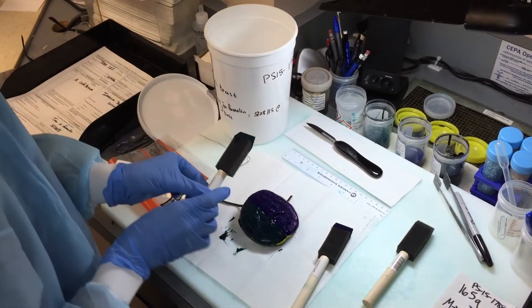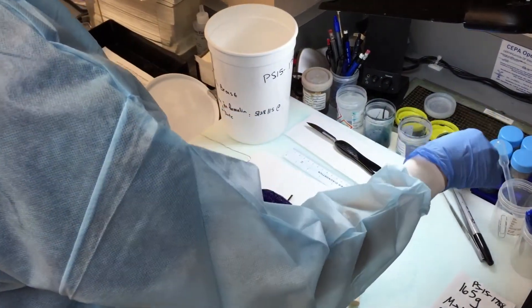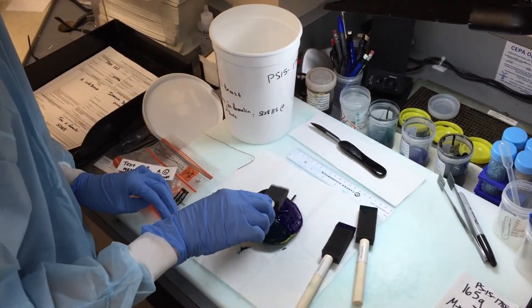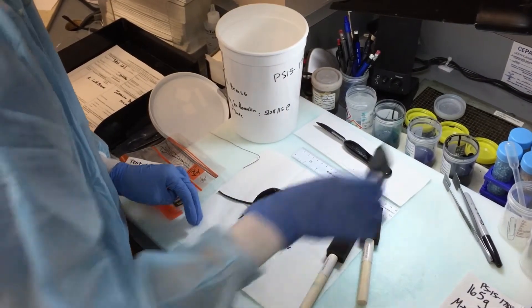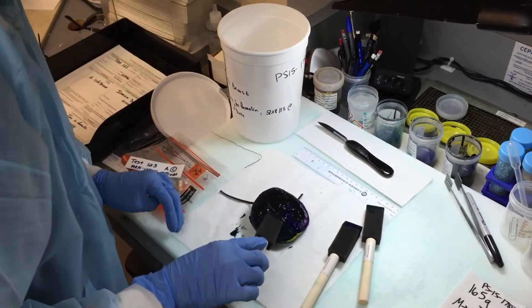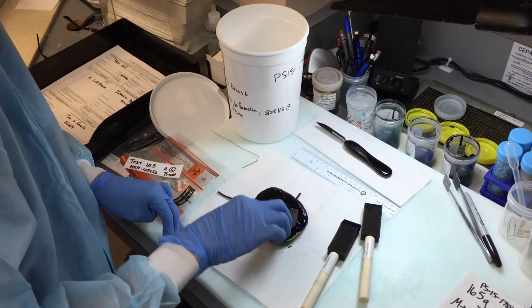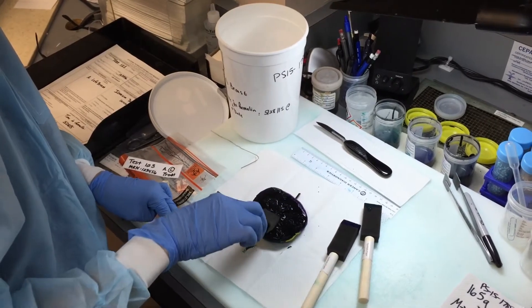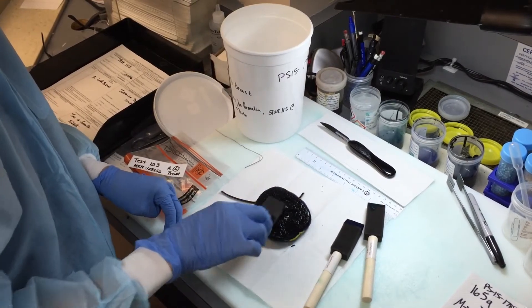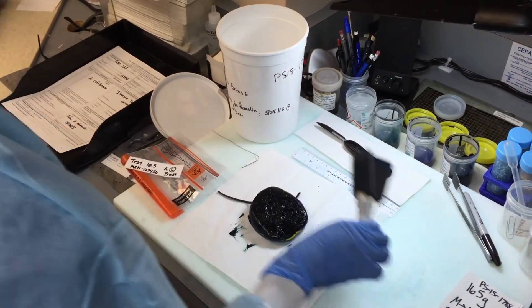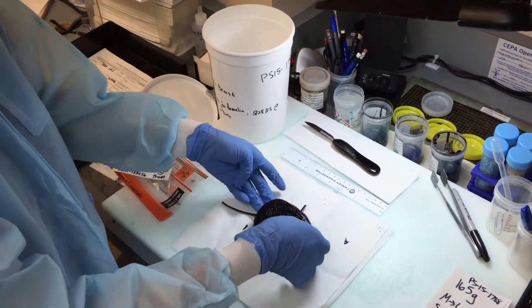Okay, and once you have the blue and green, you just want to secondarily overlay the black ink on the deep aspect. Okay, and then you would use the acetic acid to fix the ink.